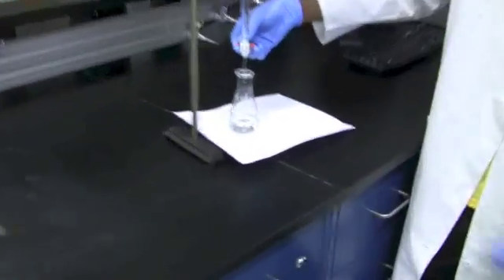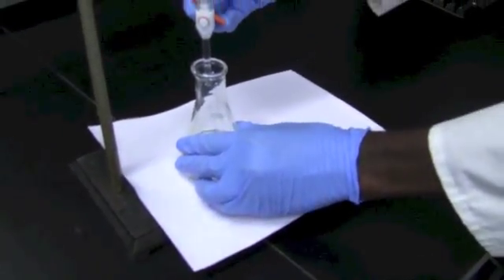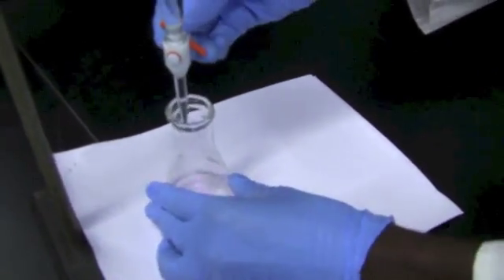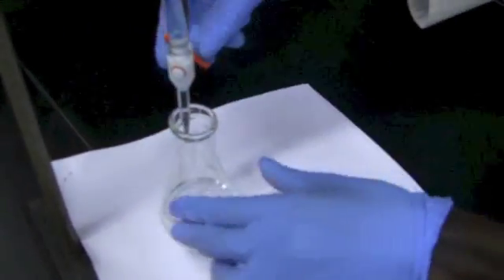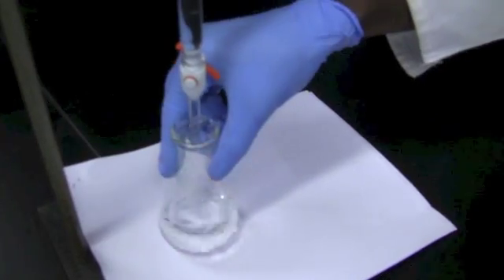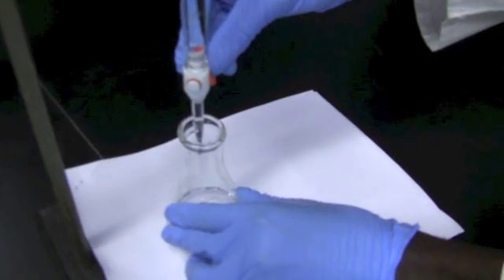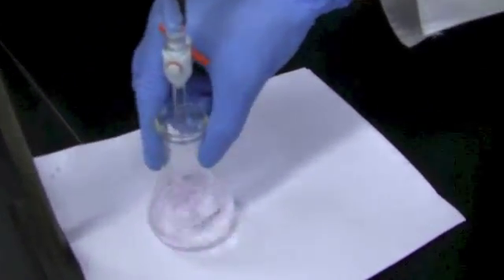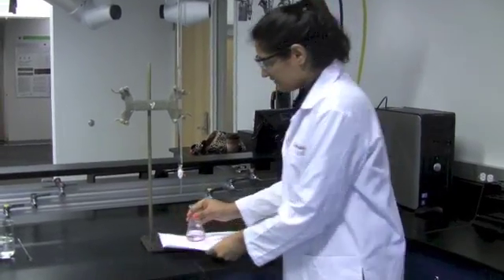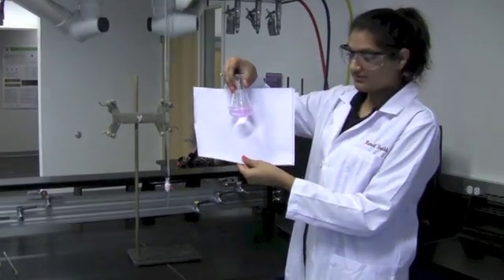As we reach the endpoint, you'll see that the color becomes more persistent. Our goal here is to get a light, faint pink color. Gently stir as you see the color. Towards the end of the titration, the pink color will last a bit longer. And once you have the final drop, it will be a persistent pink, a very faint pink like this.